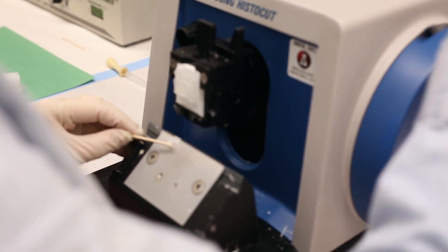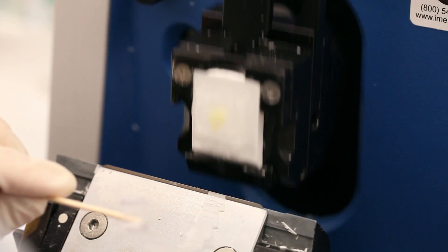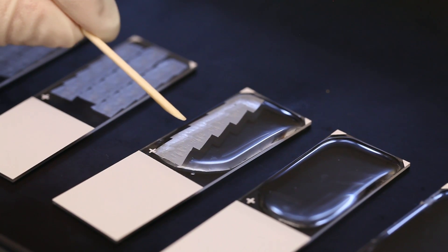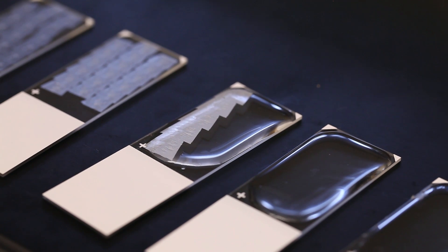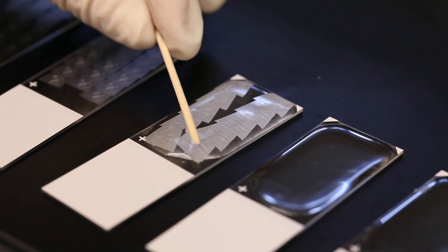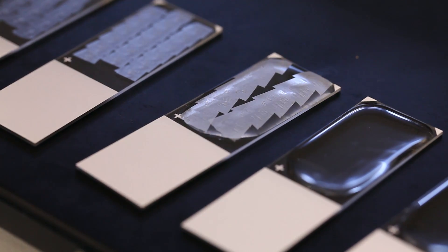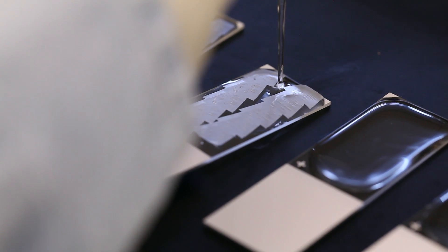As I turn the wheel, the wax moves past the blade and it cuts little tiny sections of the plant tissue. Now I'm going to lay those sections on the surface of the water, and as they land you can see they flatten out — the warmth of the water melts the wax just a little bit and helps it relax. That allows the sections to sit really flat on the surface of the glass slide. Once we're happy with how the sections have flattened out, we remove the excess water. Now all our sectioning is done; we have to wait four hours while the sections adhere to the slides.